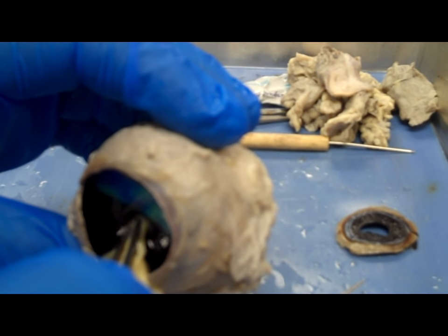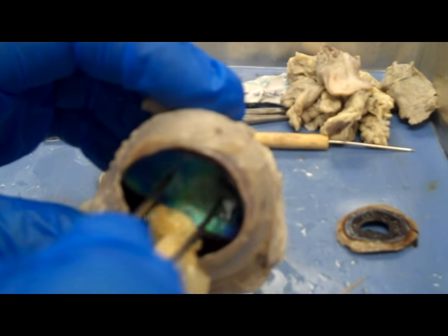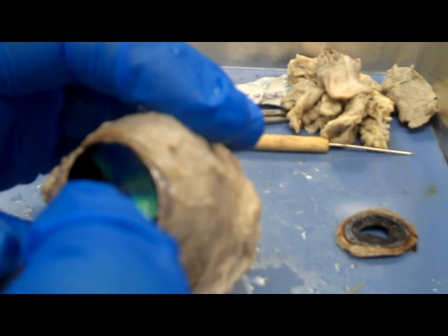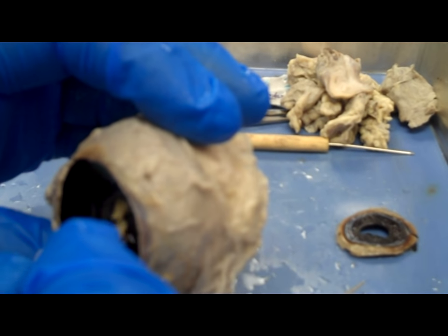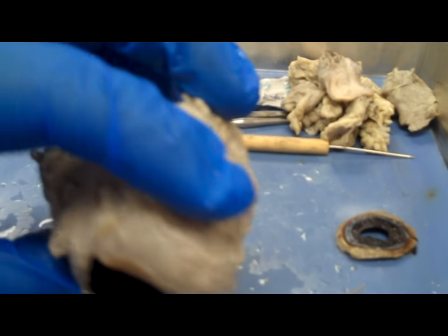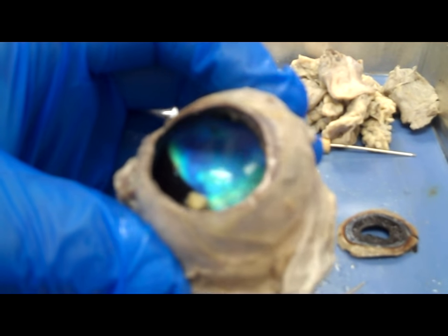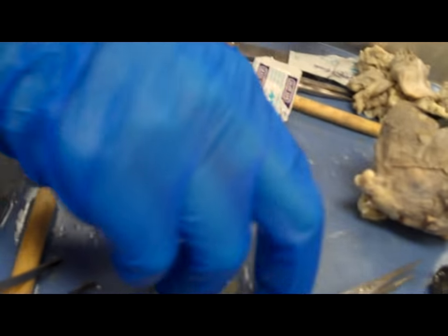At the very back of the eye you can see that iridescent background. That layer is called the tapetum, and the tapetum is what gives the reflection — in cow eyes as well as things like cats, so you've seen their eyes reflect before as well.